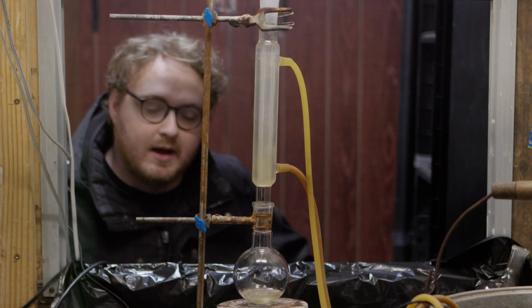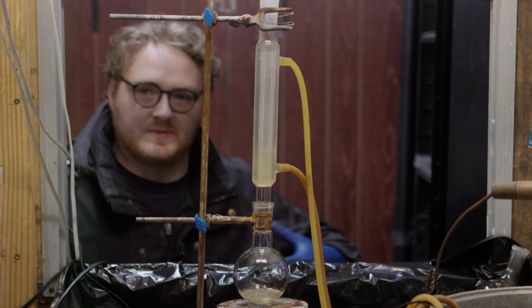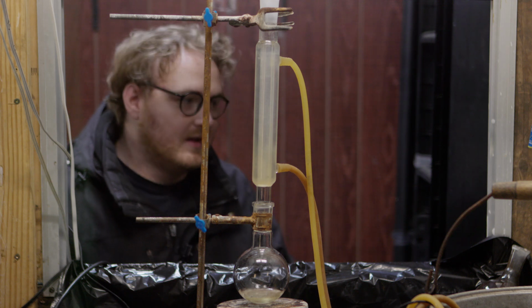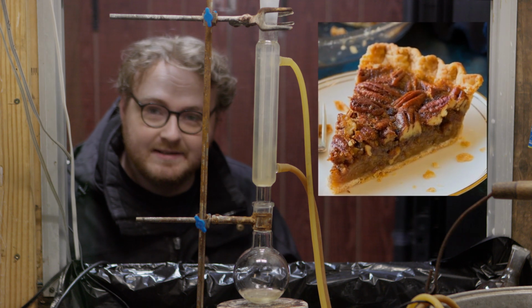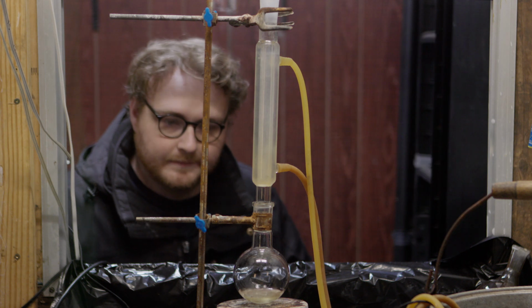Okay, and we're back. I did not leave the fume hood on overnight to suck up all the vapors. I didn't really think it was all that necessary, and I'd rather it be sort of warm in here. But then when I came back into the lab for the first time, it smells like a butter pecan pie. It's a very nice, sweet, nutty scent that I'm getting in this lab. So hopefully we can sort of isolate that in this oil.